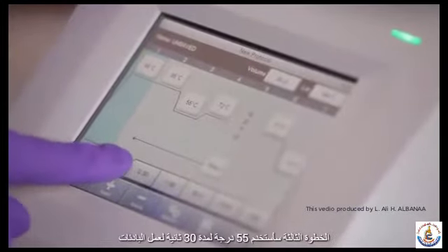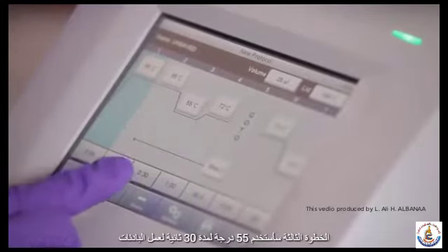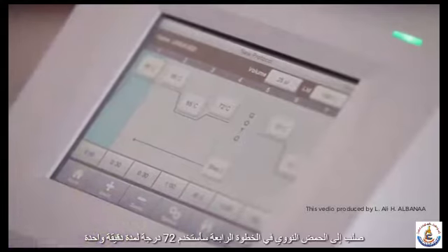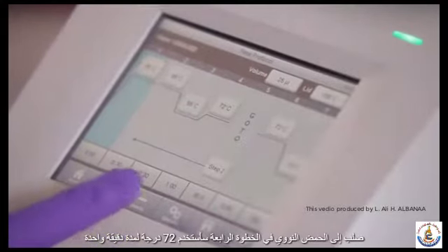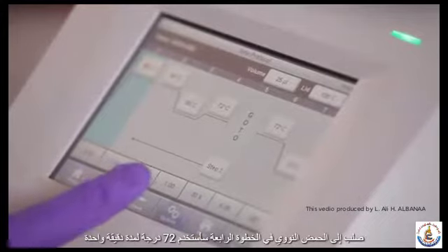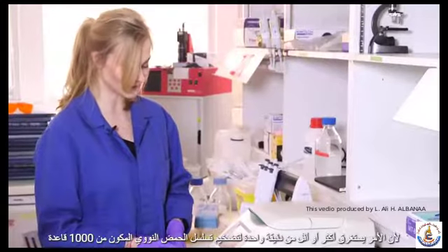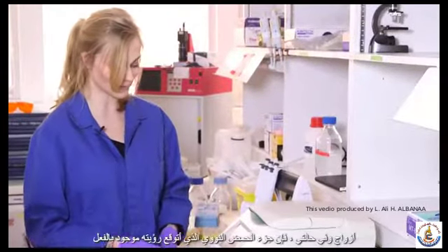Then in the third step, I'm going to use 55 degrees for 30 seconds to make the primers anneal to the DNA. In the fourth step, I'm going to use 72 degrees for 1 minute, because it takes more or less 1 minute to amplify a DNA sequence of 1000 base pairs.